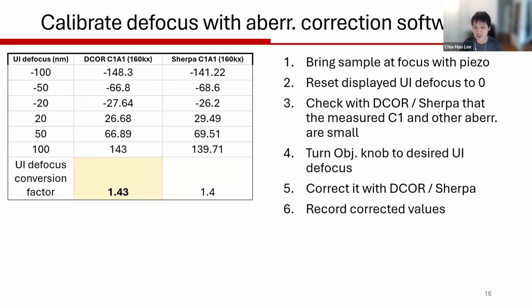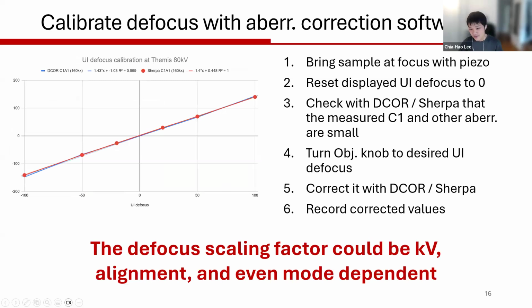And after that, once all the aberrations are aligned, you can just turn your objective lens knob to change your focus to, for example, 20, -20, 50, -50. You change that, and then you correct it with your aberration corrector software to see, based on the retrieved optics value from the microscope, what defocus value the aberration correction software thinks you actually have. By doing this, you will form a very nice straight line showing that yes, we do have a scaling factor between the displayed defocus value from your user interface and the actual defocus value based on the optics.